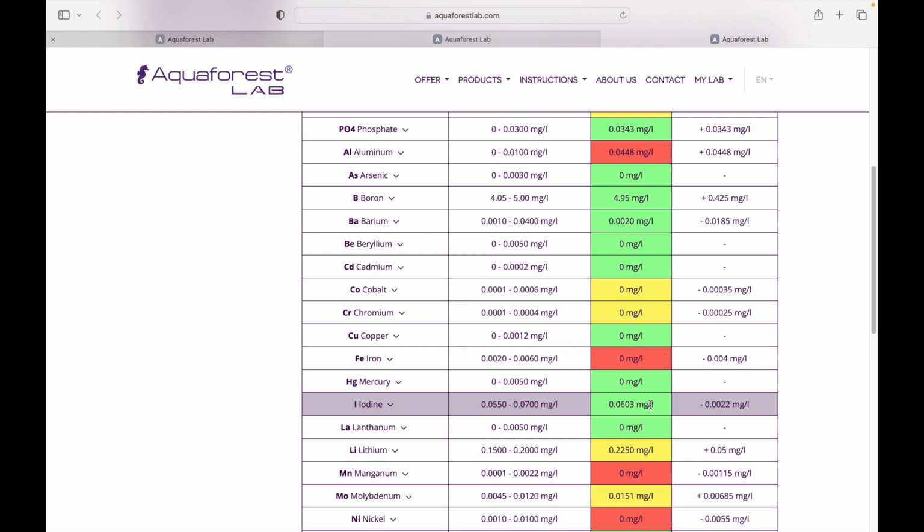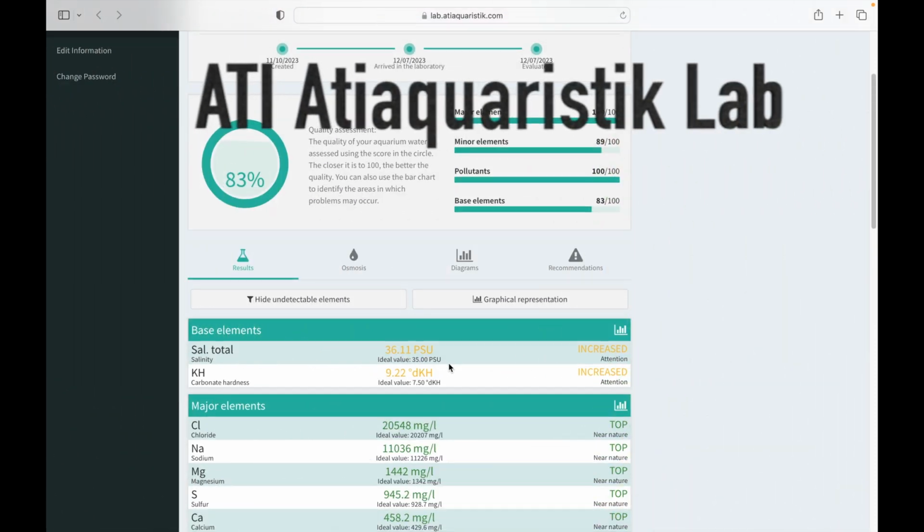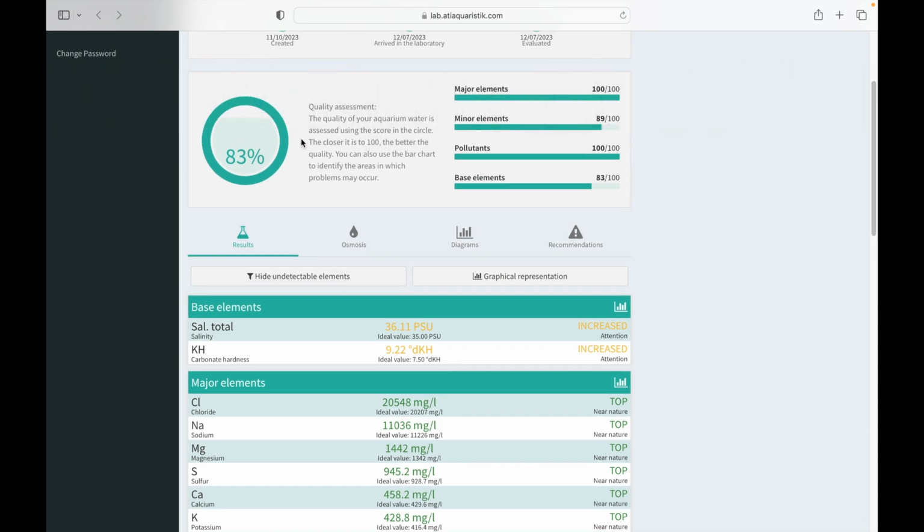Yeah. Let's look at one more coming in here. The last one was ATI. So let's have a look at ATI and see what they've got going on here with their test. Maybe we get a little bit more consistent here. We'll see. This one's also showing the salinity as being a little bit high. We got an 83% total score. So the minor elements we were fairly low on. The rest we weren't bad.